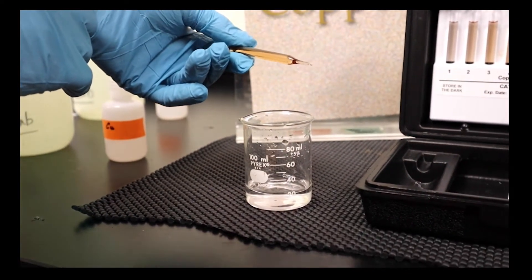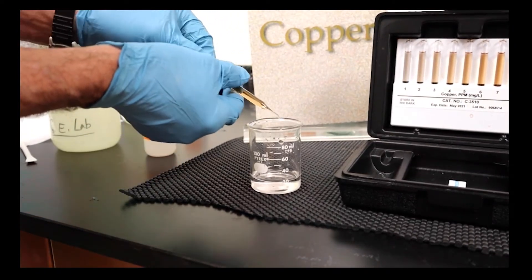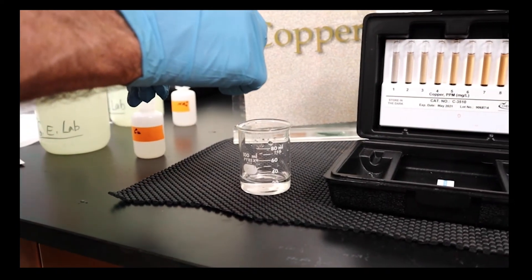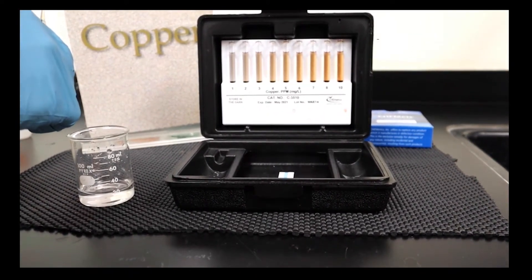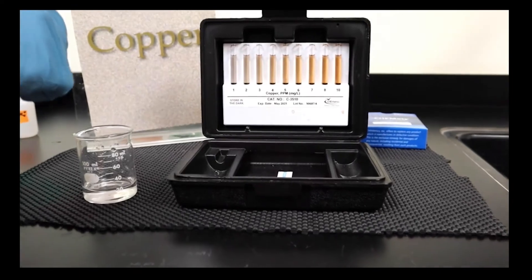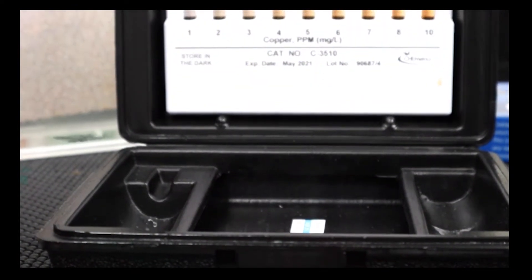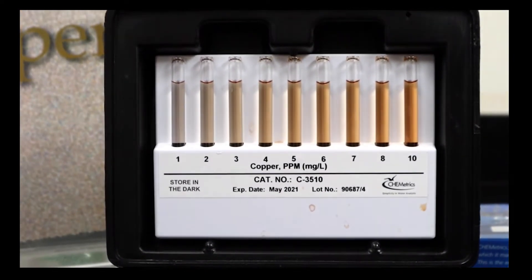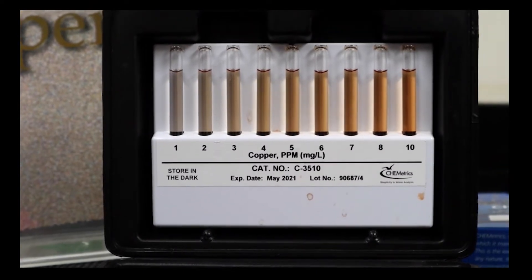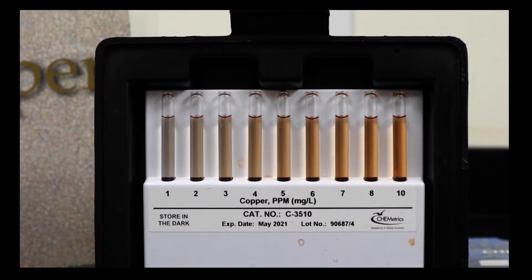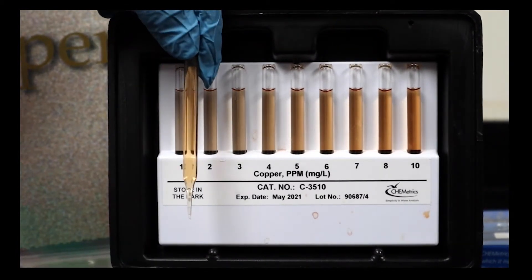Let's check the time, and we'll give this—this one's a little faster—we'll give this a minute. Let's see where that falls.